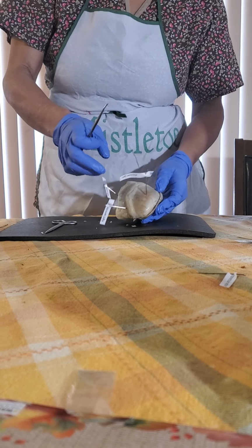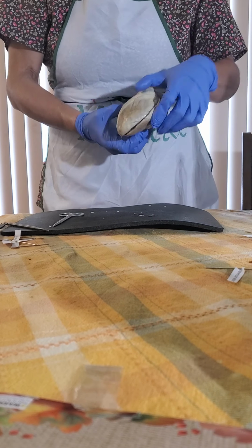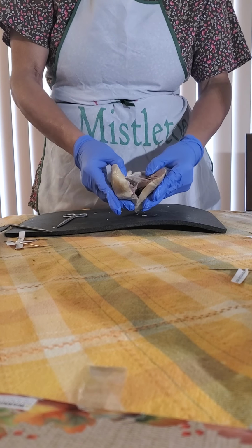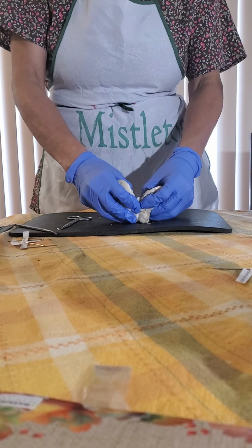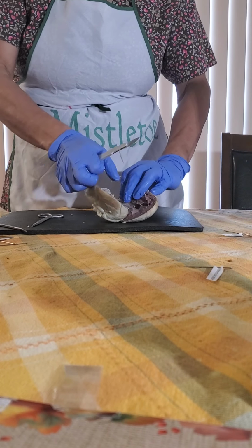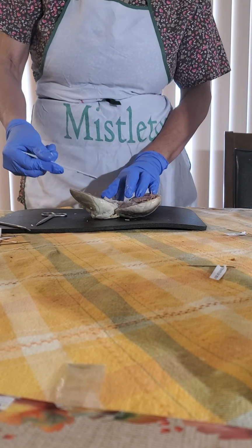Now, there is a different view of the major structures, like if you see it from the side, you're still looking at the right side, left ventricle. So now, if I cut it in the frontal plane, it will show the internal structures. Every heart will look different depending on how you cut it. Internal structures between the right ventricle and the left ventricle. The landmark is the thick myocardium that surrounds the left ventricle.